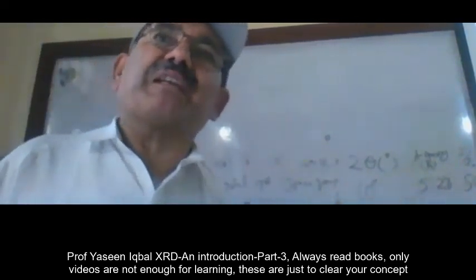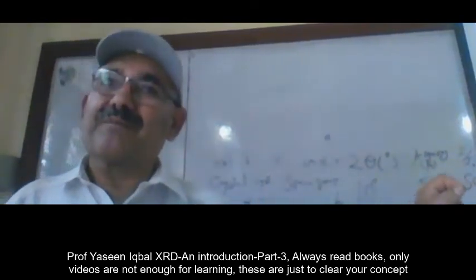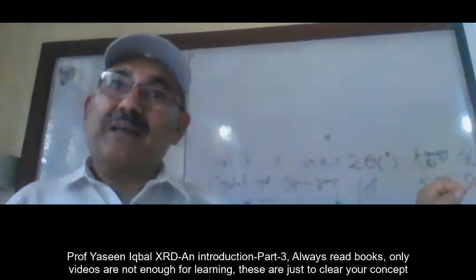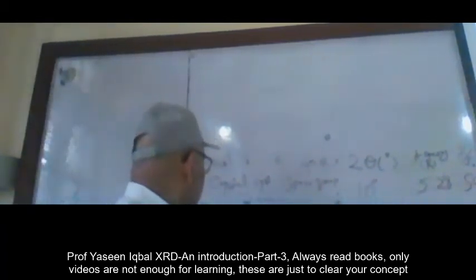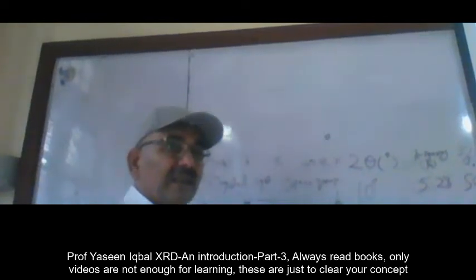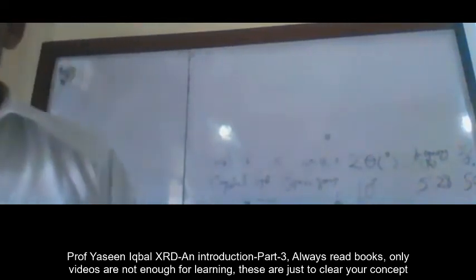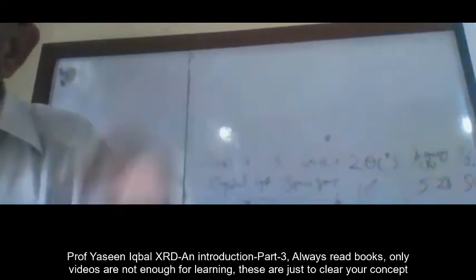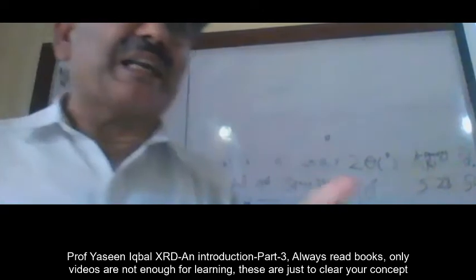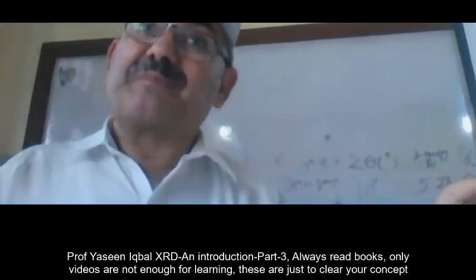So it is not a must that the peak you get in your experimental data should be of intensity 50, right? But if the next peak, for example this one, is 100, then this 50 should never be higher than the 100. The 100 should always be 100 if your data is matching that phase.